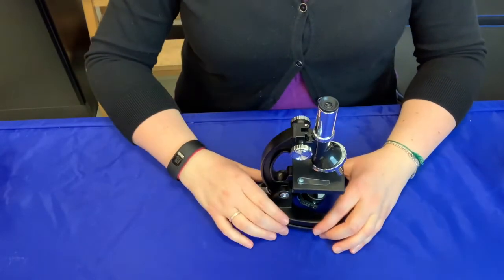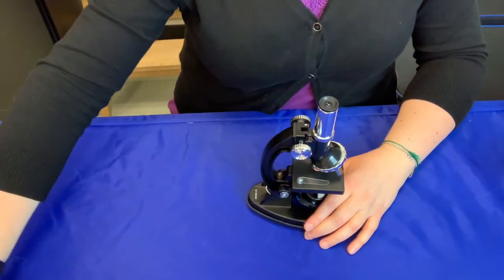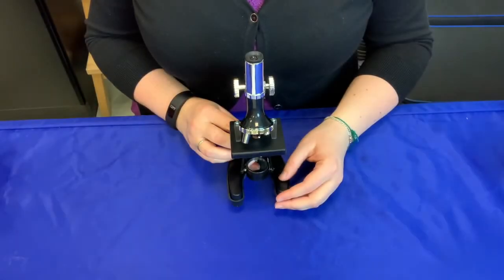And lastly, remember to return the microscope and slides back to the case when you're not using them. Next, let's look at how to set up the microscope.